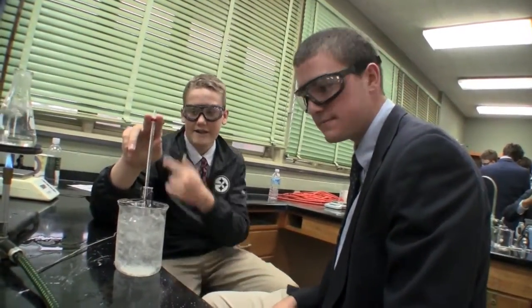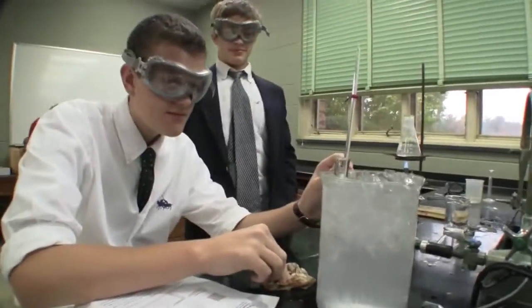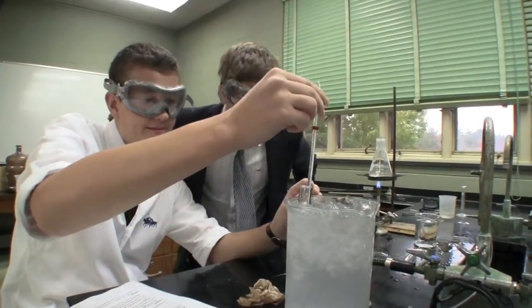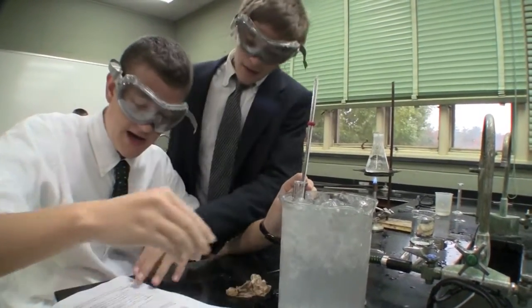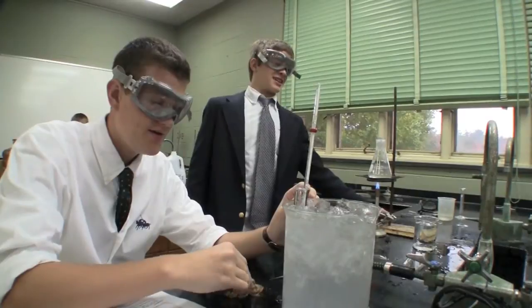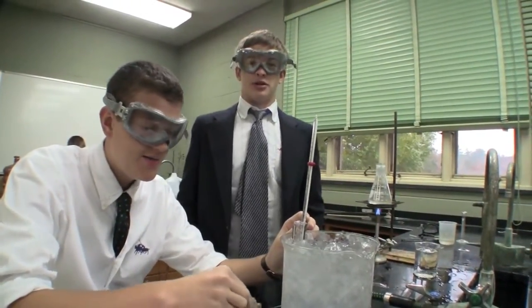It heats up a lot faster every time. We're waiting to see the salt. It's at about 17 degrees. What volume of water are you on? 9 milliliters. So 10 milliliters is going to take a while. We added salt so it allows us to go below zero.